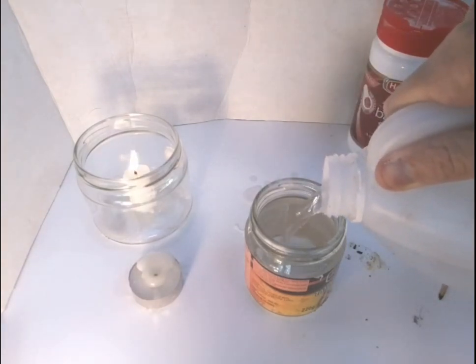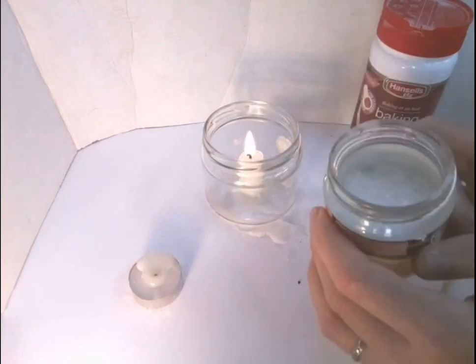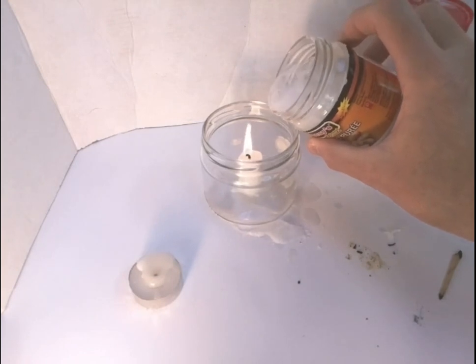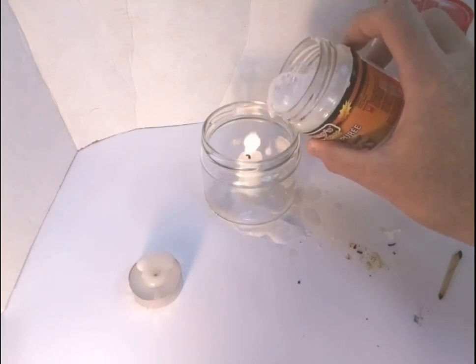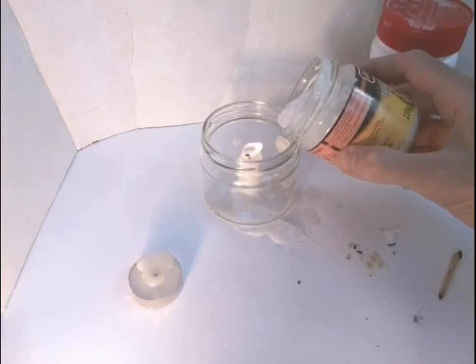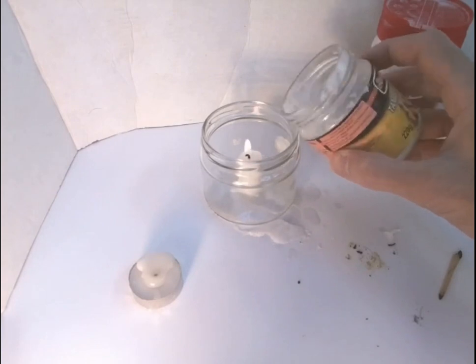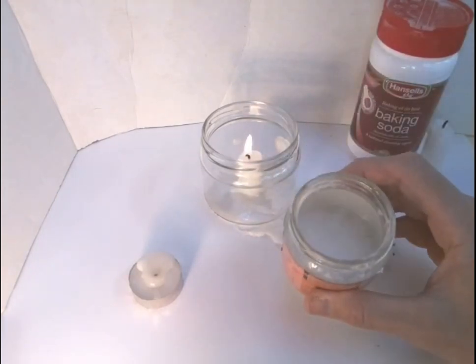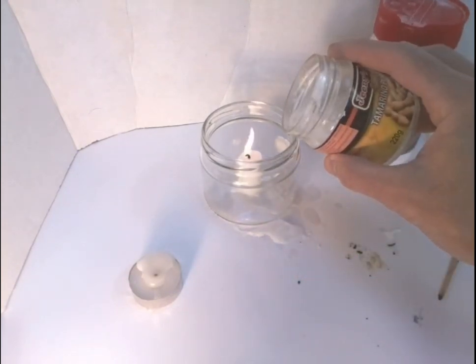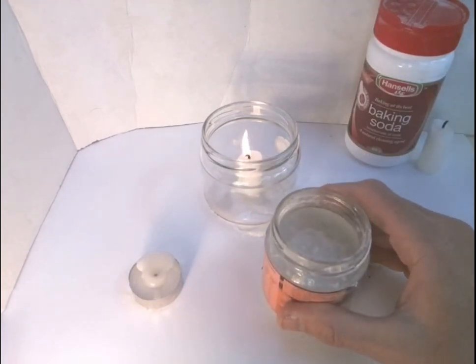And pop some of this in here, and immediately it starts to foam and fizzle up. Now, that foam indicates that a gas is being produced. We want to pour the gas into the jar with our candle. But I think this one's actually producing so much foam and muck that it's pushing most of the gas out of the small jar and not leaving any in there for me to pour out into the larger jar with the candle in it. You just saw it almost blow the candle out there with the carbon dioxide, but not quite. So I'm going to try this again.